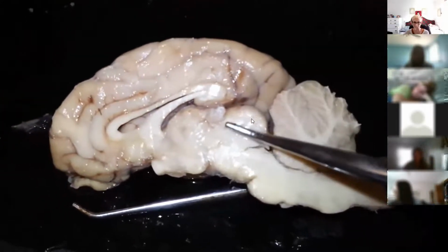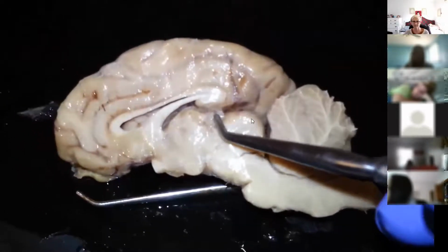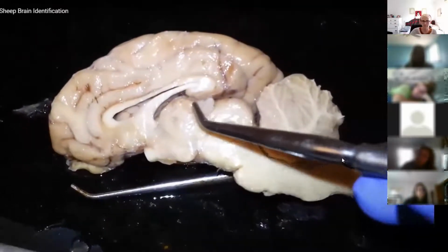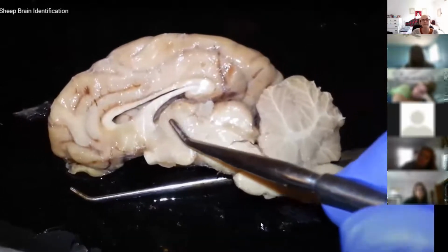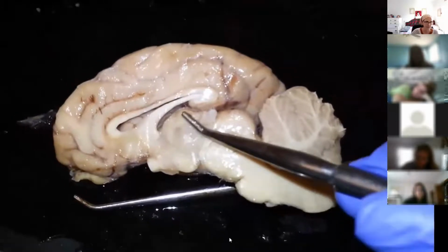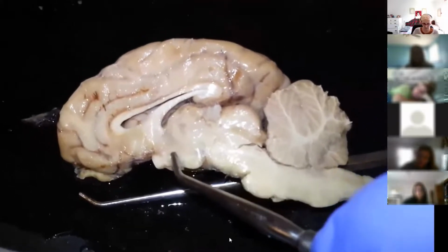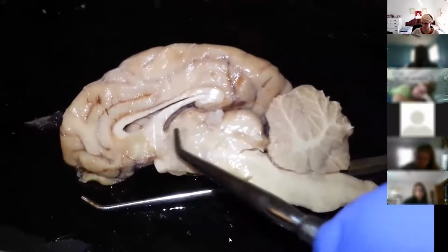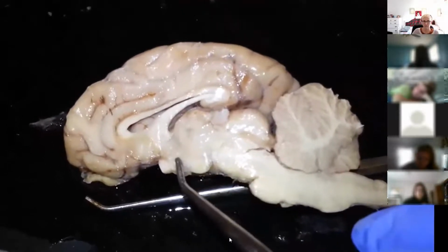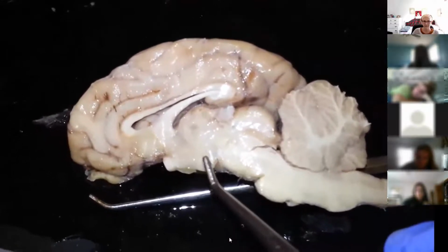So moving on, anterior to the corpora quadrigemina, you have the pineal body. So this round part right here. And then next to that, anterior to that, you have the thalamus, or what's sometimes known as the intermediate mass of the thalamus. Below or inferior to the thalamus, you have the hypothalamus, which you can tell is the hypothalamus because it's the tissue that's either below the thalamus, or it's the tissue in between.